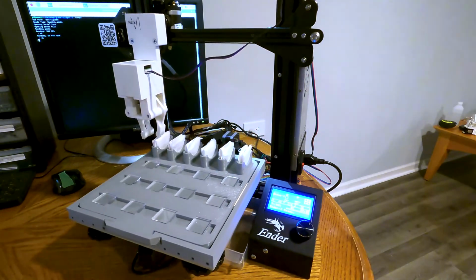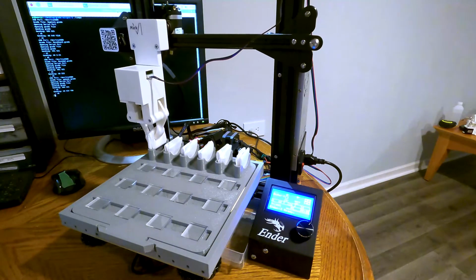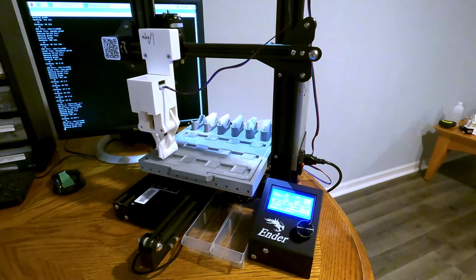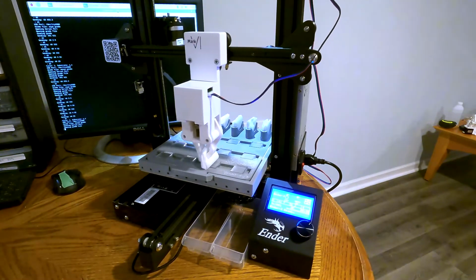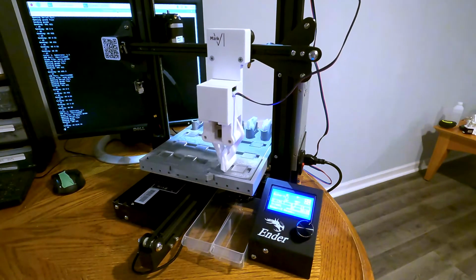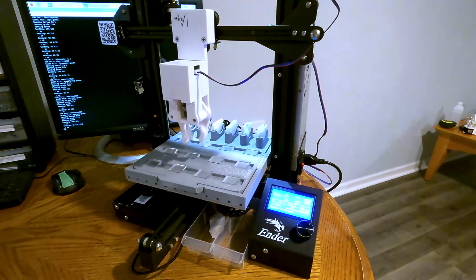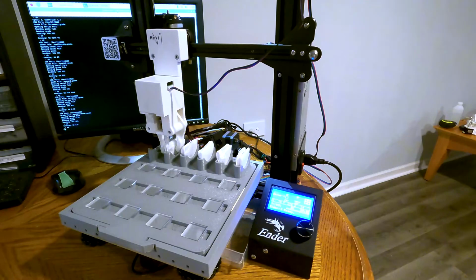The robot starts by traveling to the first napkin position, picks up the first napkin, and goes to the first row. The robot then repeats this cycle down the row. EPA guidelines require 4 wipes per substrate sample, which the robot performs. After completing a row, the robot discards the current napkin. After discarding, the robot picks up the next napkin and repeats the cycle until all the substrates have been wiped.